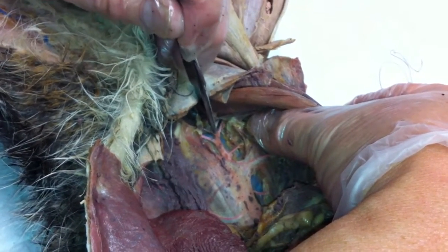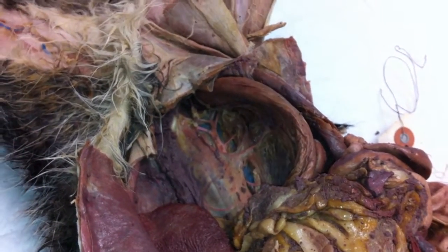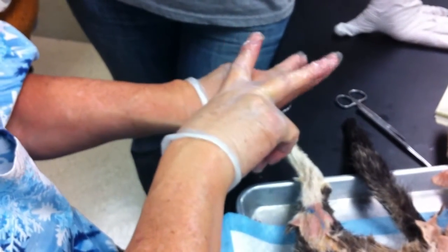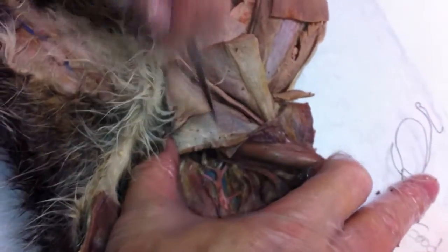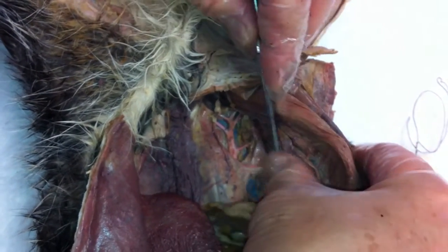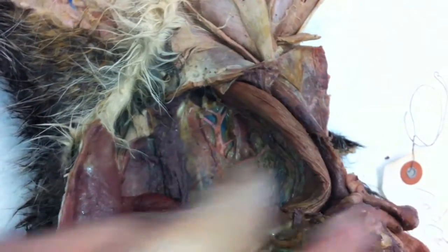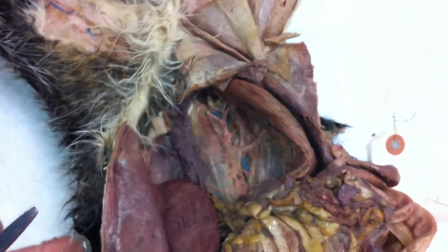Right there, that's a common iliac. What you see are two V-like structures. The top ones are the external, the bottom ones are the internal, and the connecting piece right there is the common iliac. And this is the inferior or caudal mesenteric.